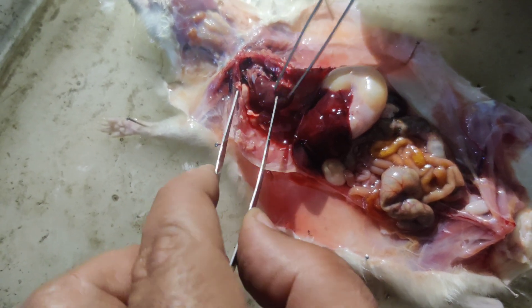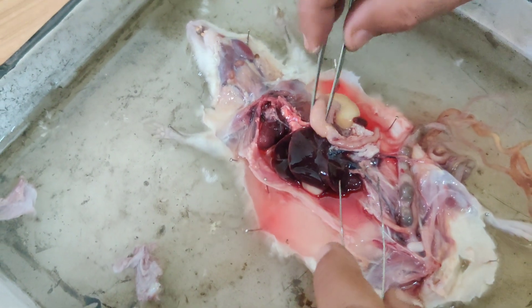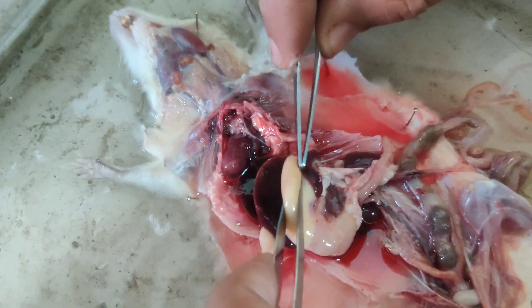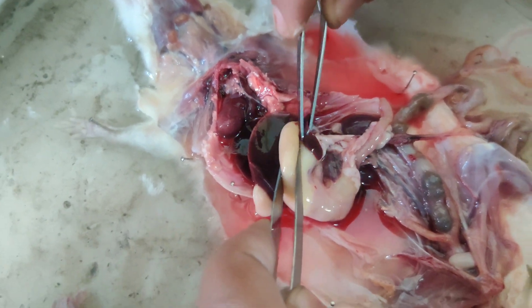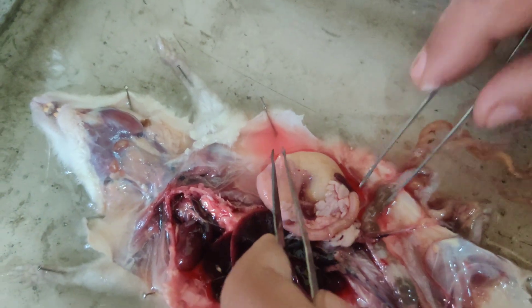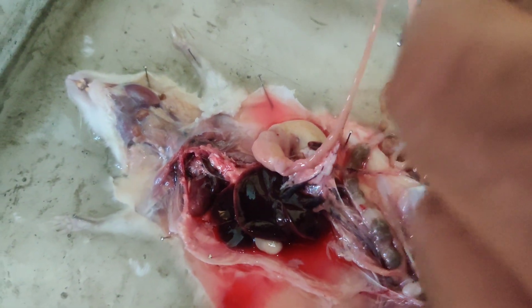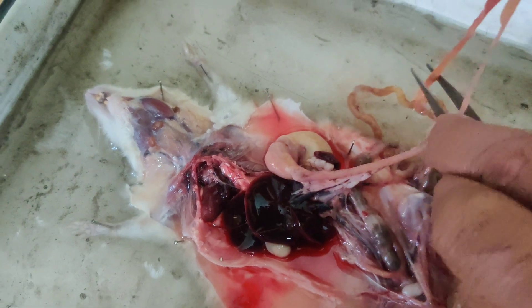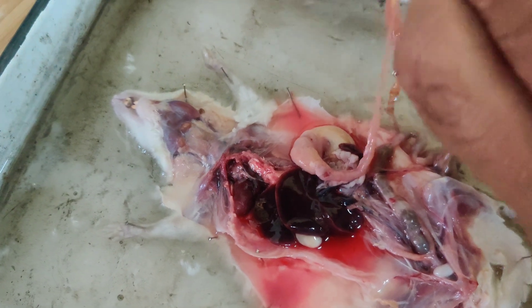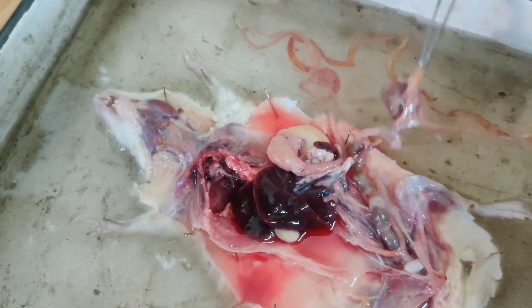Now see the digestive system. This is the stomach, and attached to the stomach you can see this structure — this is the spleen, this reddish structure. Then this is the duodenum, and below that is the small intestine — all of this is small intestine.